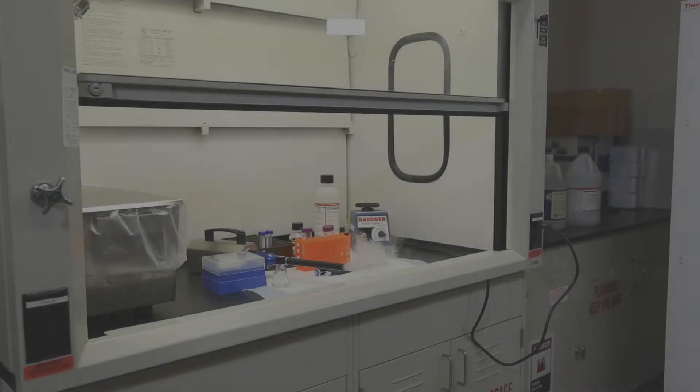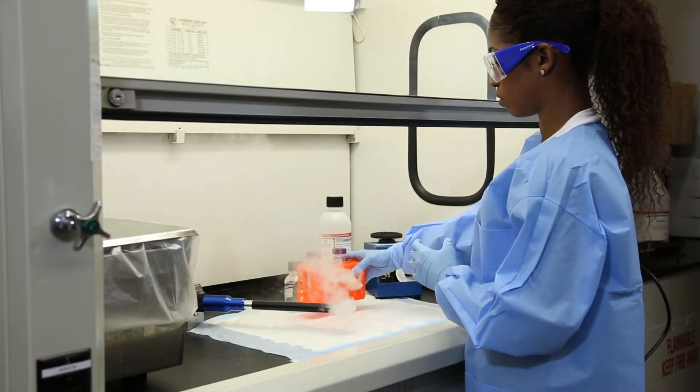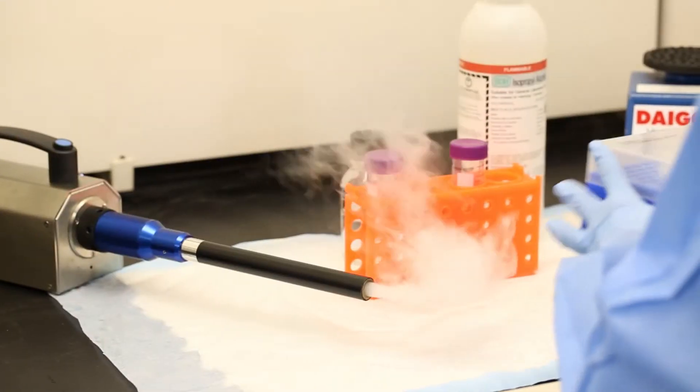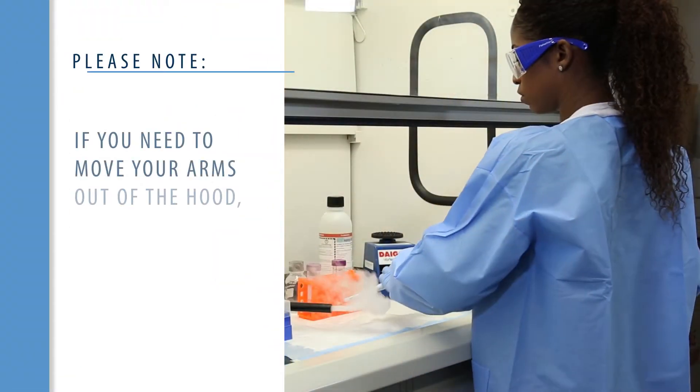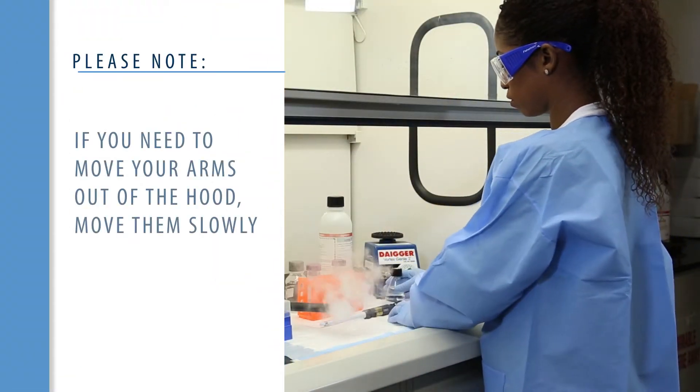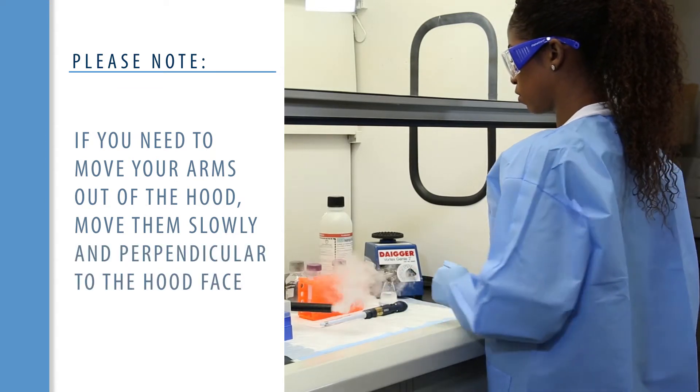Place equipment and materials inside the hood before work begins. If you do need to move your arms out of the hood, move them slowly and perpendicular to the hood face.